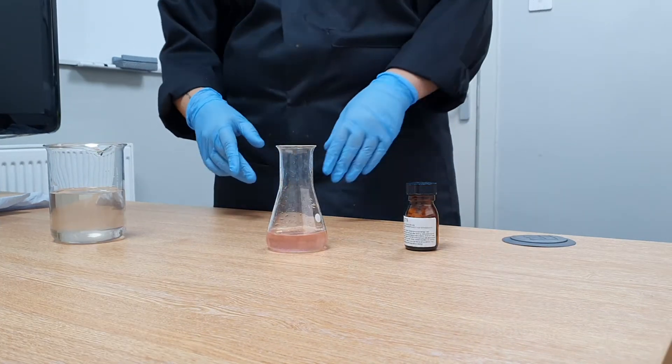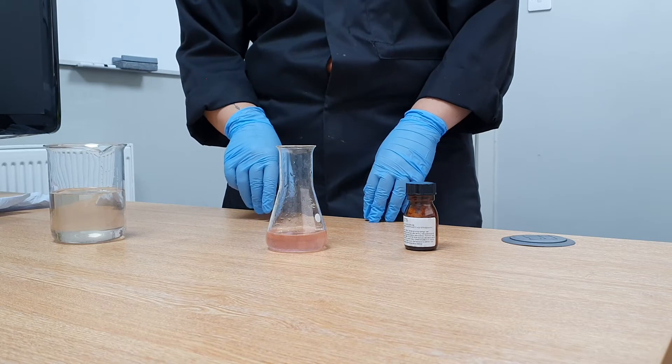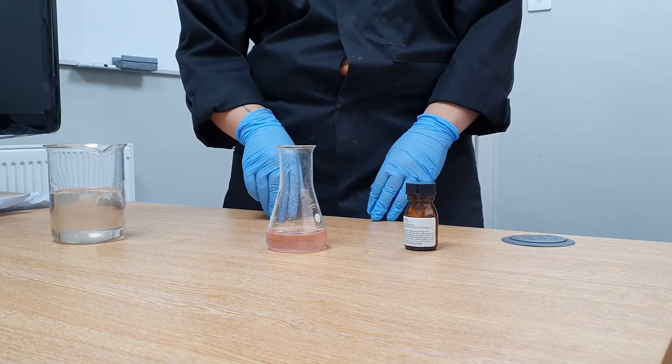If a red colour develops when the tablet is added to 20 ml of sample the total hardness is greater than 10 mg per litre.